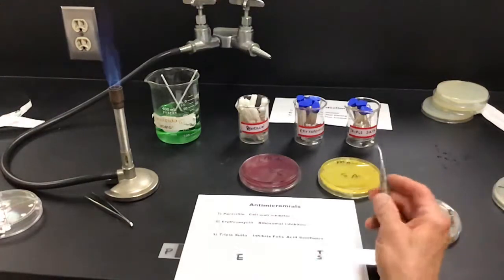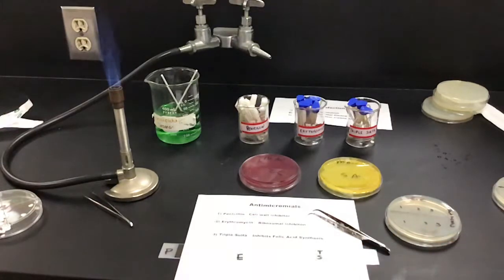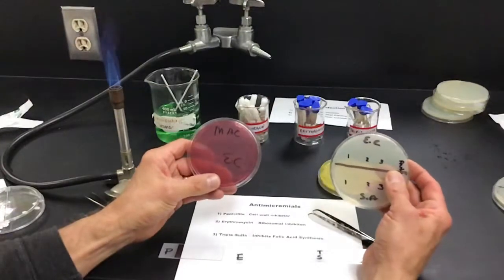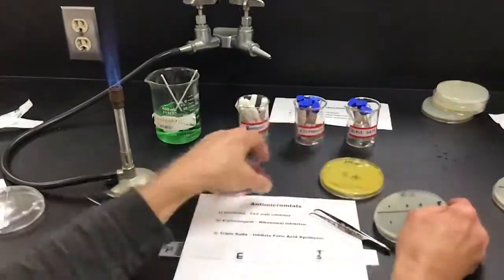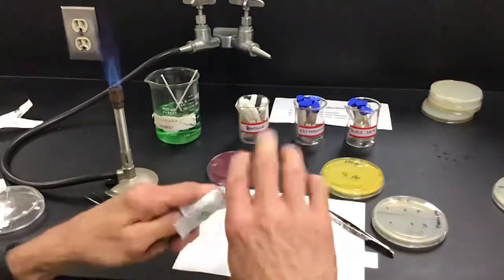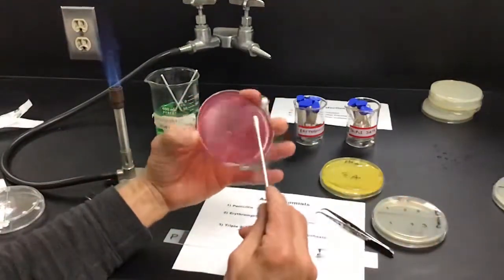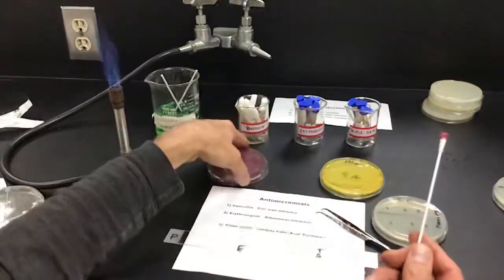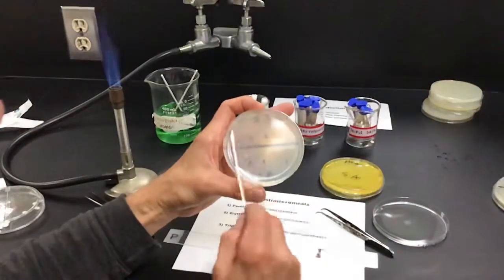So what I'm going to do today is swab the plate like I did with the disinfectant. I'm going to swab one with E. coli, which is our gram-negative, and one with Staph aureus, which is our gram-positive. All right. So let me just grab a swab here, sterile. And I'm going to grab some E. coli off of here. We've got some colonization here, not a whole lot, but enough so we can lawn this. So I'm going to lawn this. Make sure you don't cross the line.